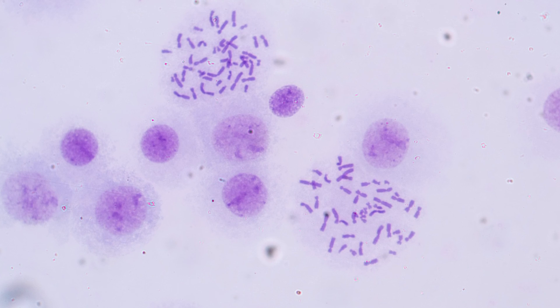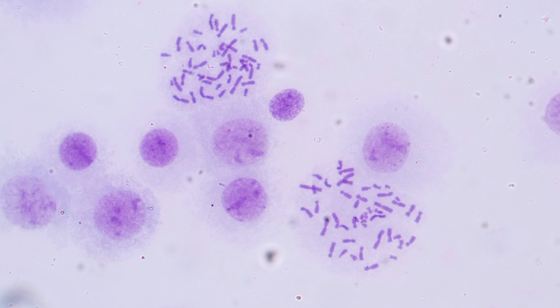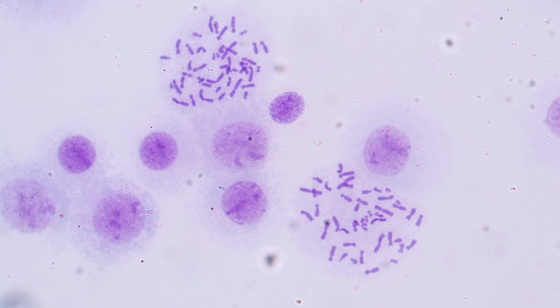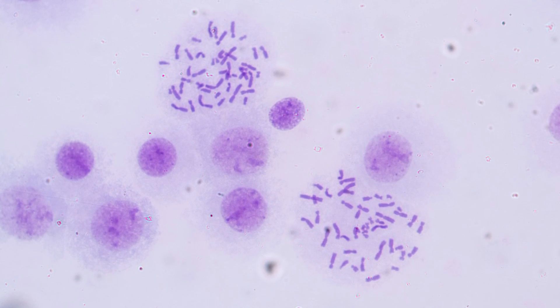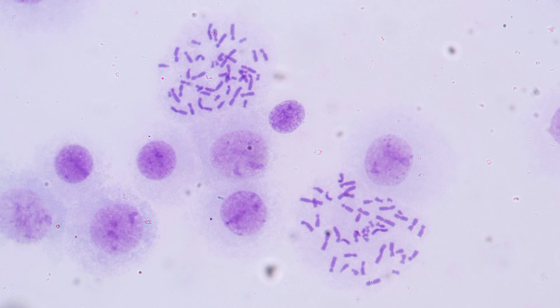When you stimulate the myeloma cells to divide in the dish, there are other cells in the bone marrow besides myeloma cells, and they often divide much more readily. So as you're looking through all these chromosomes, usually what you're seeing is normal cells. You have to hunt through the slide to identify ones from the myeloma. We generally look through 20 cells — we try to find 20 myeloma cells and see how many abnormalities they have. It's quite laborious and it would be hard to do much more than 20.